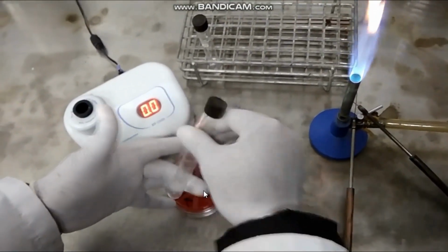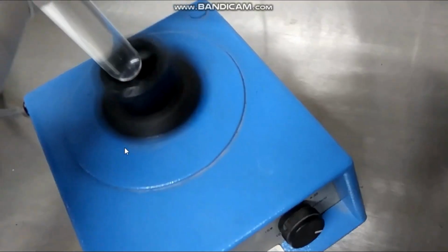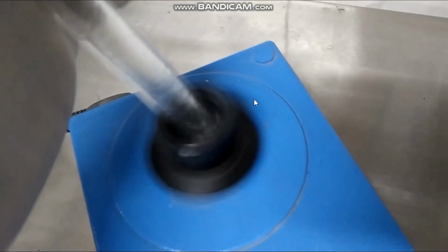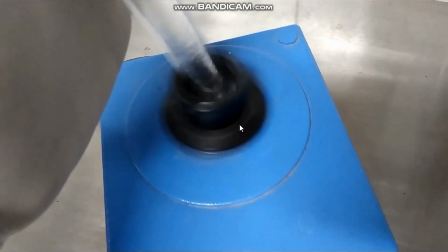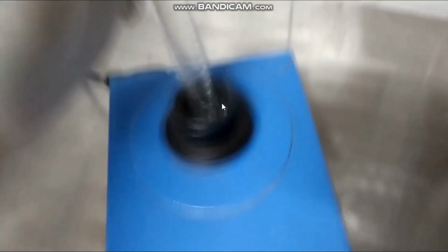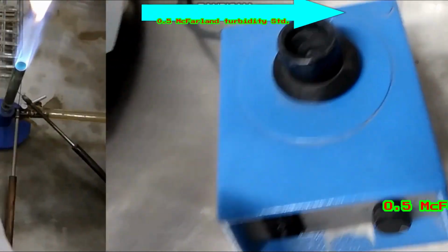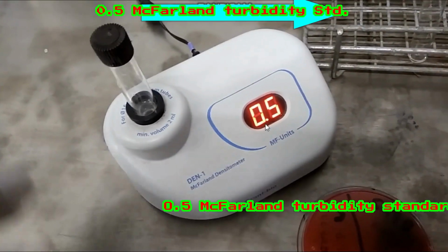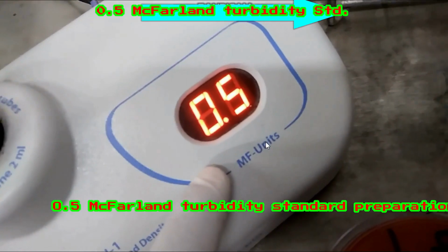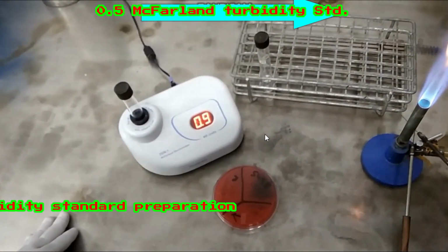You can mix manually like that or using vortex mixer for uniform suspension, okay. So now let's, wow, this is our required concentration.